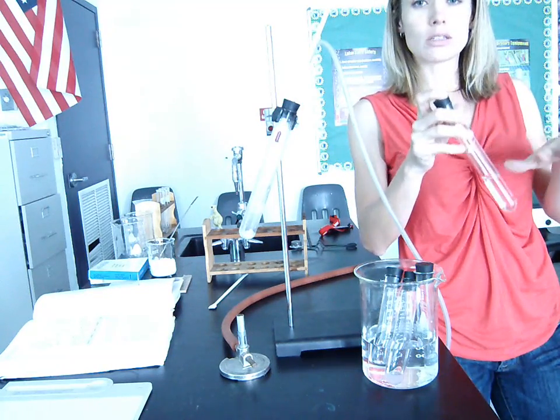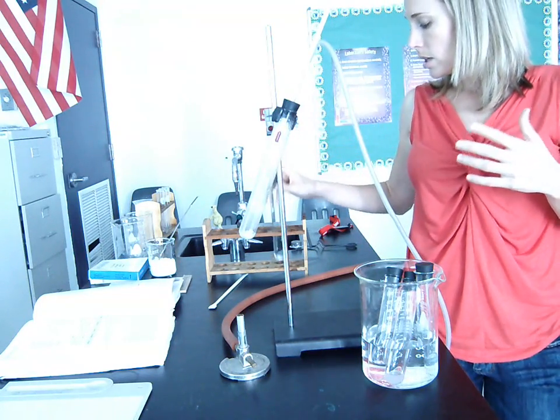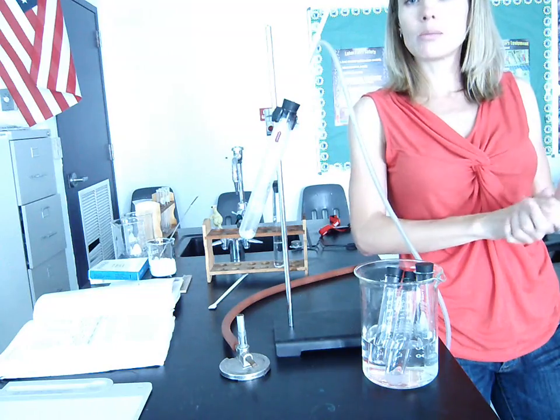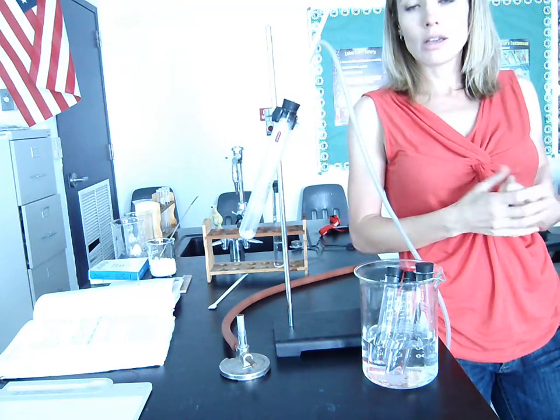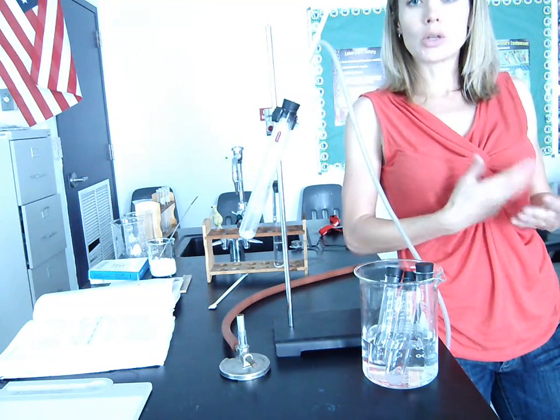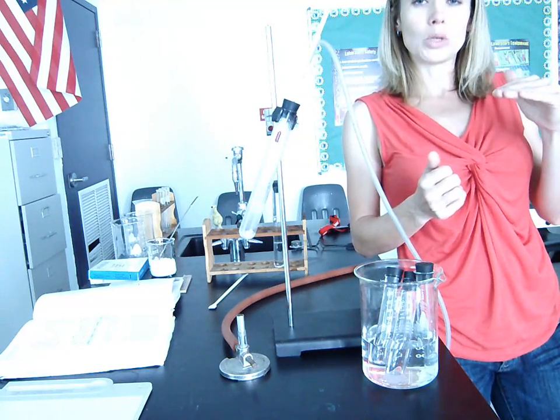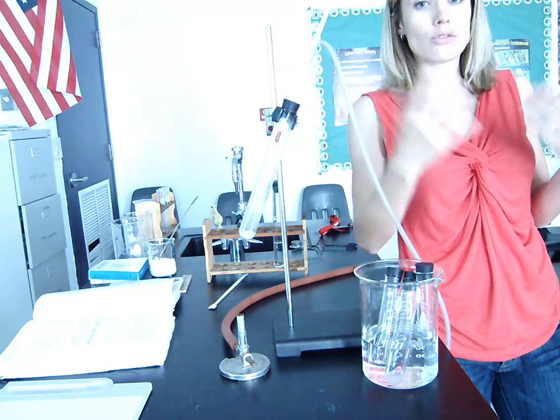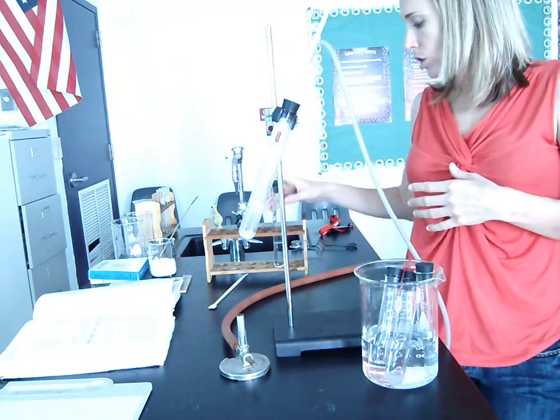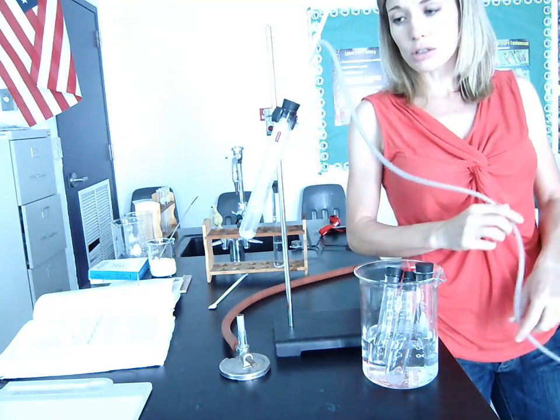So we would take a sample of this and just boil it to dryness to figure out what the two boiling points are. What we would find is that there's a boiling point at 80 and a boiling point at 100, which implies that there's two distinct liquids. Because if you remember back to chapter 3 on characteristic properties, boiling point is a characteristic property, and most liquids have distinct and separate boiling points. So the fact that we have a boiling point at 80 and one at 100 means that we've got two liquids, one that boils at 80 and one that boils at 100. Once we have that knowledge, then we can go ahead and actually do the separation by fractional distillation.